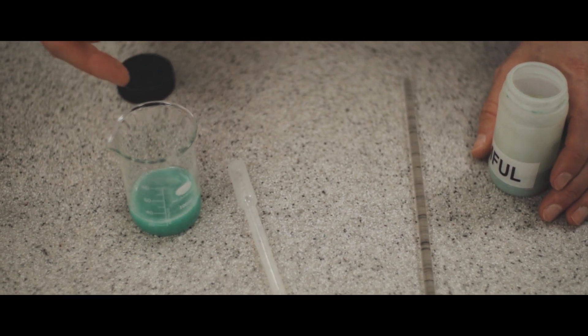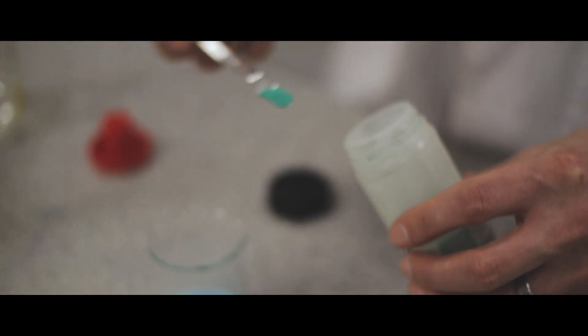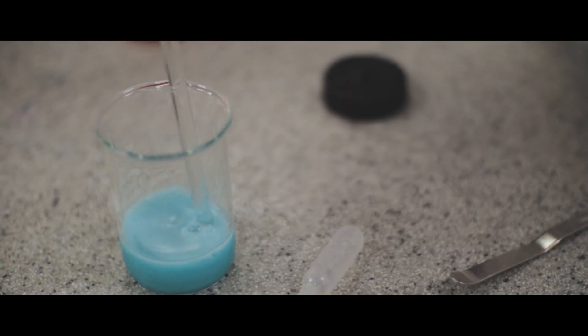So bubbles are produced and those bubbles are carbon dioxide gas. If I add some more copper carbonate and we get more effervescence, I know that the acid is still present and it hasn't finished reacting. So I can mix this with a glass rod.